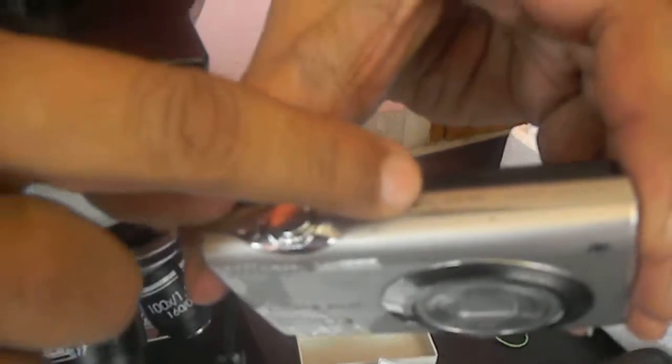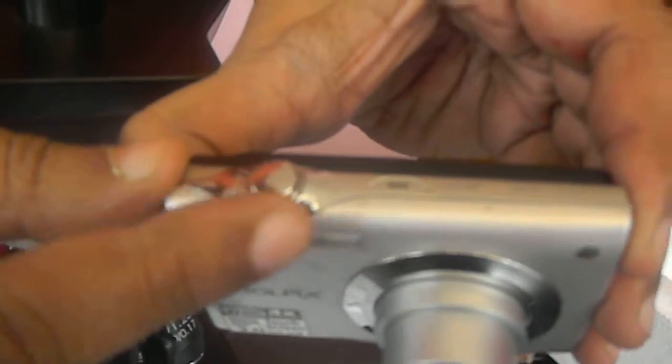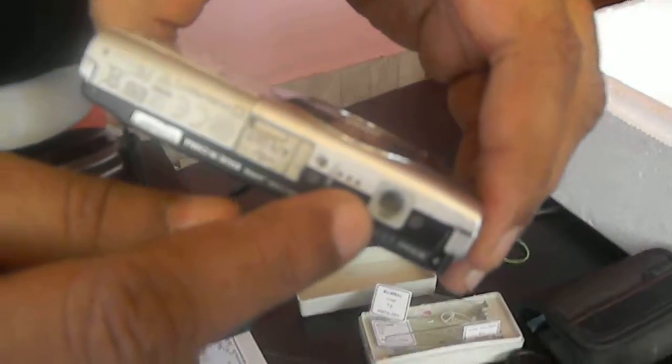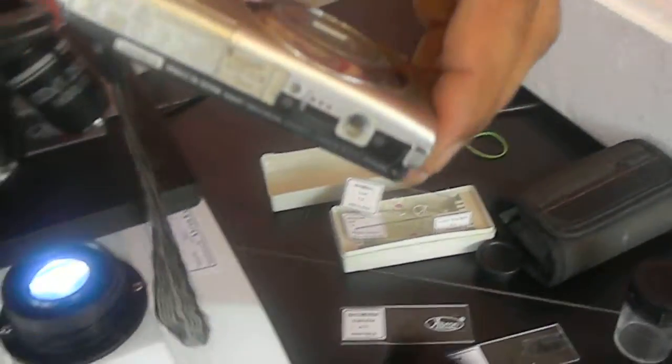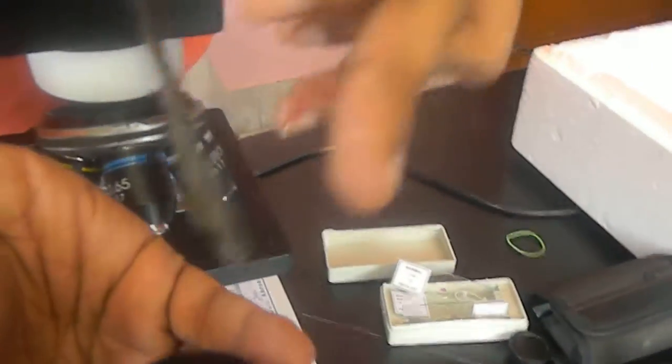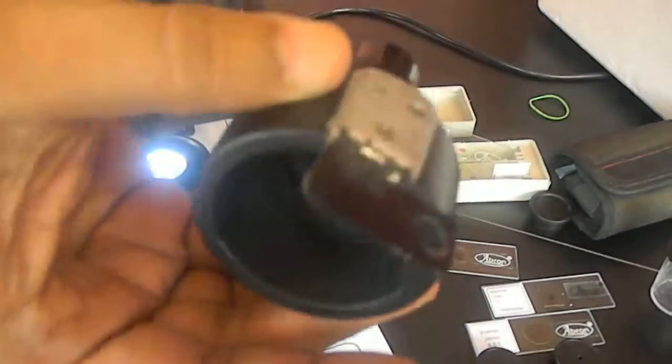There is a zooming inside. This is a zoom. You zoom it and the camera changes. This is an auto focus camera. First of all, switch it off. Keep it and there is a bottom screw adapter system. This is a special tube which has a built-in eye tube. Built-in lens is there.